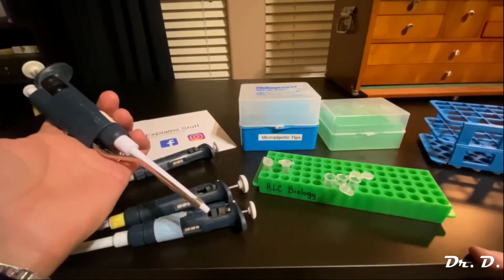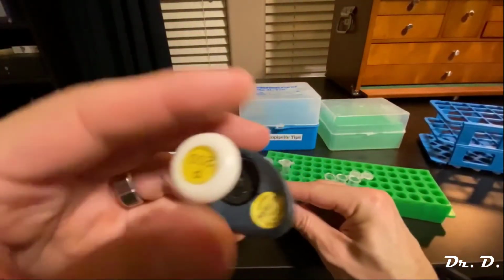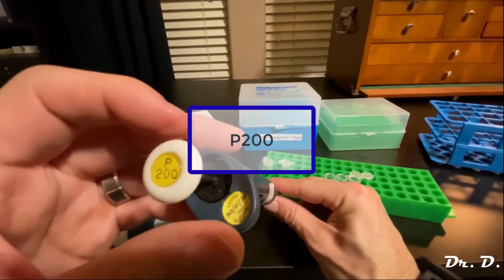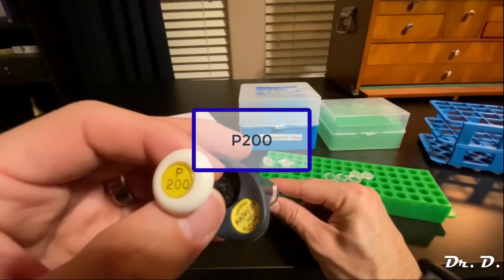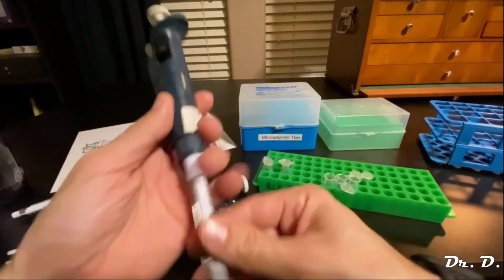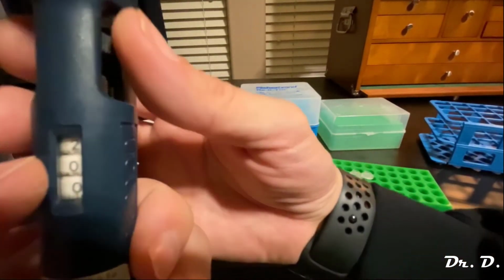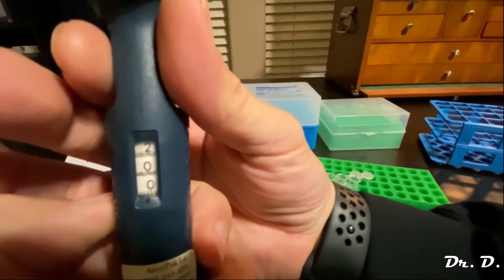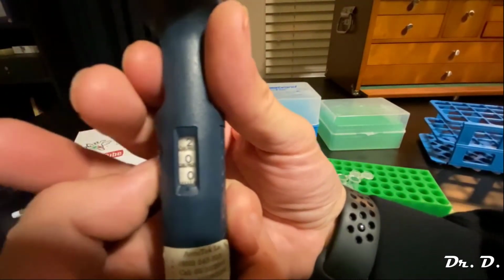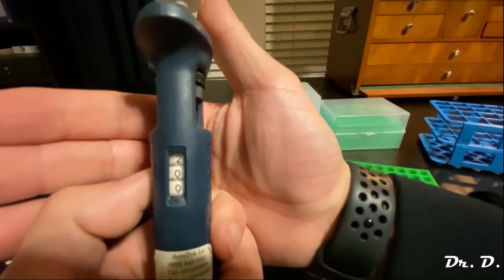This guy is called the P200. So what do you think this goes up to? Well, this Pipetman goes up to 200 microliters, which means if we look at its little dial, it's already set at its max, isn't it? It's set at 200, which means it's set to its maximum setting.